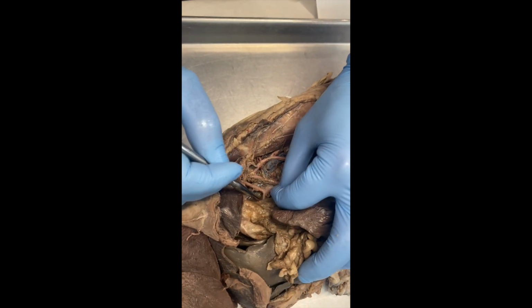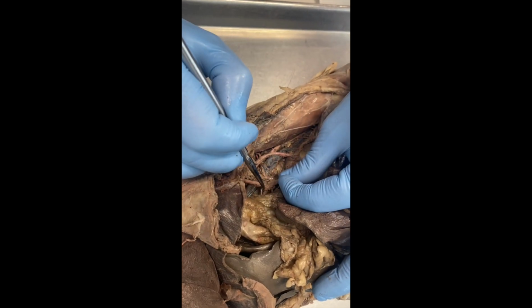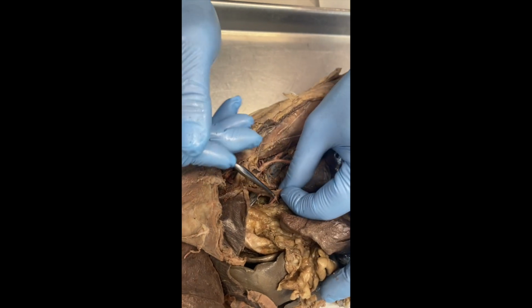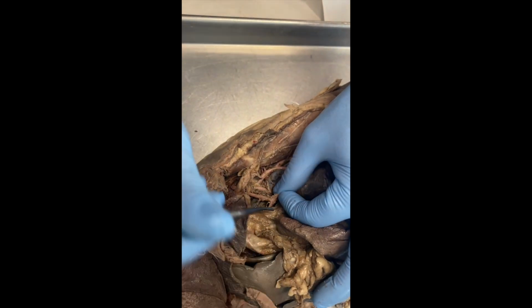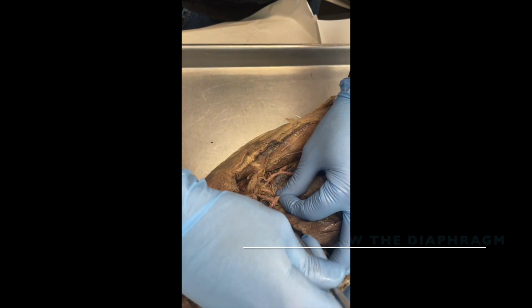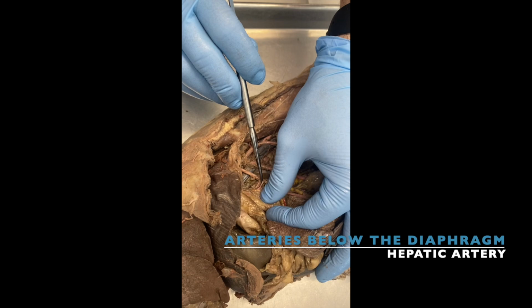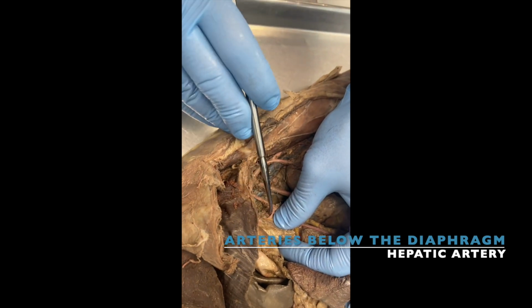Or let's see. Okay, no, I was wrong. We do. This is definitely hepatic, gastric. But you see this one right there? Right there? That's the hepatic. It was hidden right behind it. So hepatic is right there.